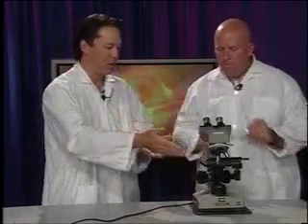Okay. That's very cool. Am I done? I like that. I could look at that for a while. You're finished looking at the specimen, but we always want to make sure that we return the microscope back to its normal position, and we put the slides or specimens back where we got them from.